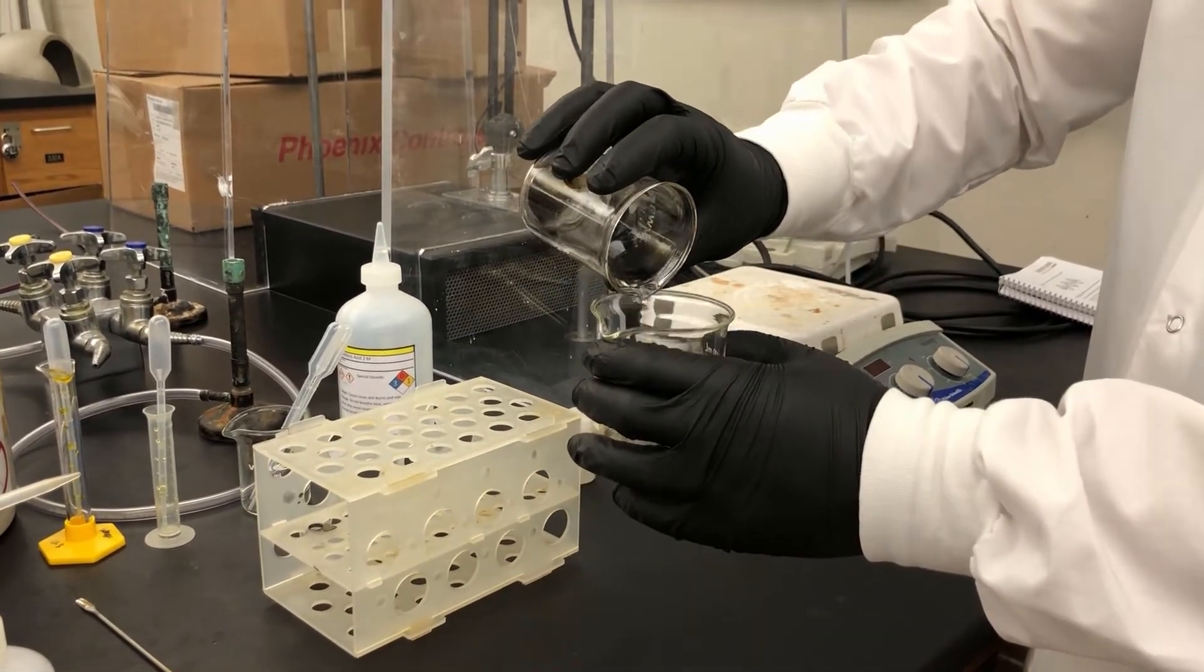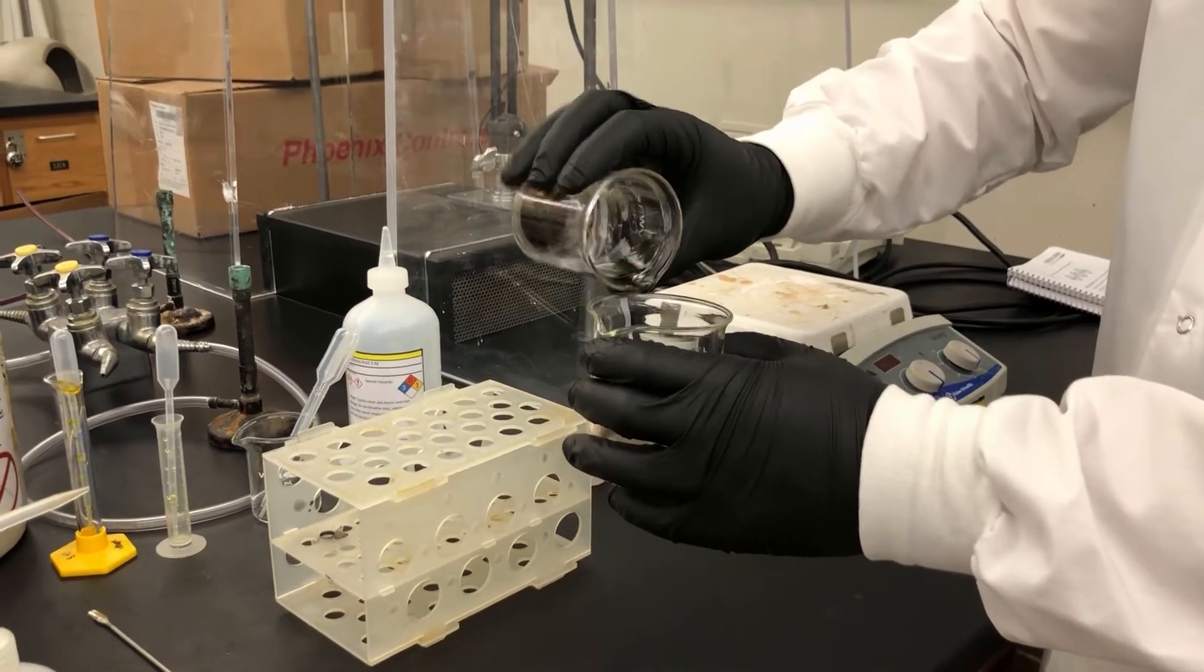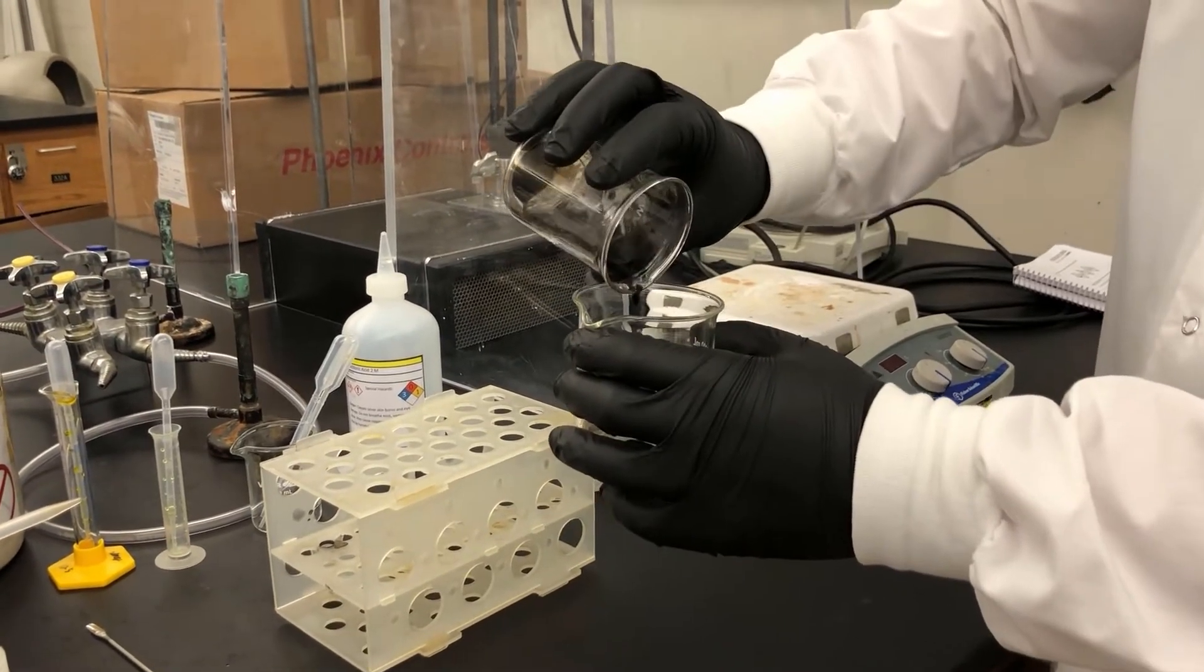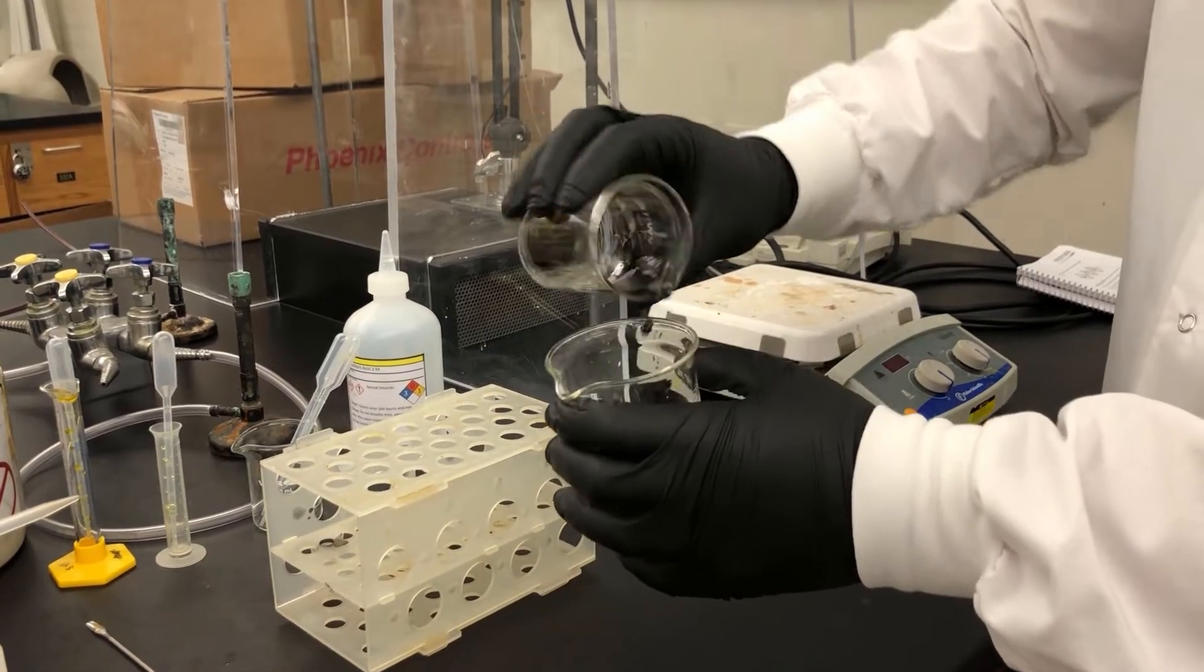Okay, so anything that I don't want is going into there. Now we're going to pour the rest off of there.